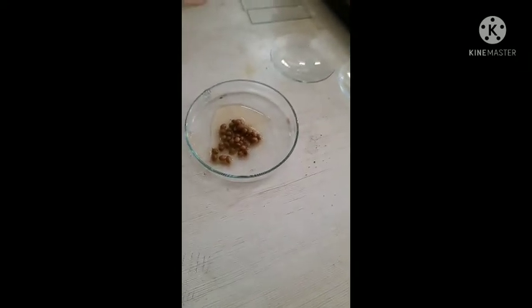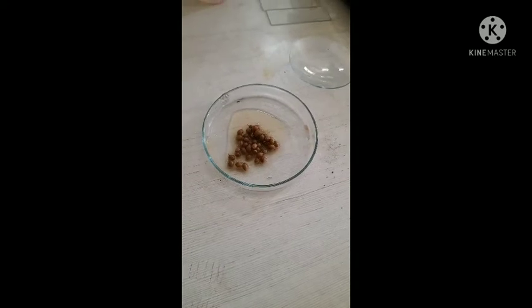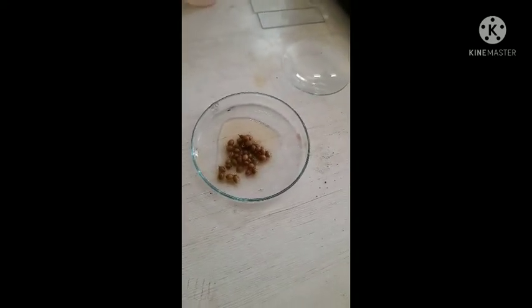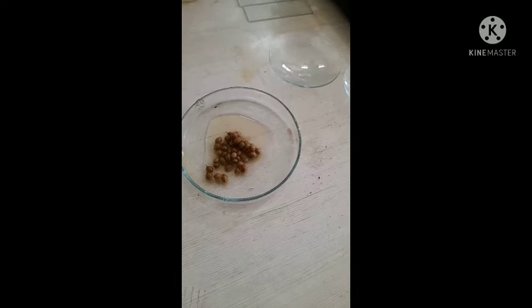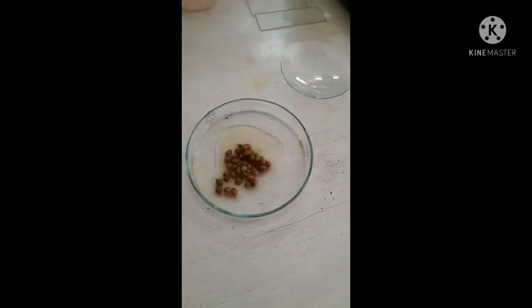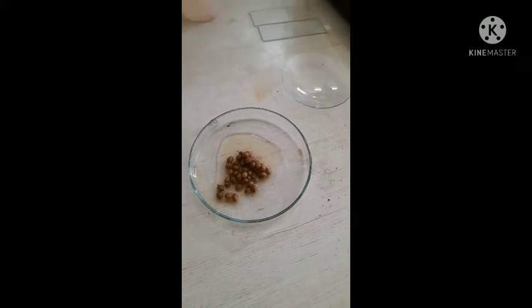First, we take the Coriander in a Petri dish which is previously boiled and cooled for 10 to 20 minutes. After 10 to 20 minutes, it gets soft. When it becomes soft, it is easy to take a thin transparent section of Coriander Fruit. It is a very tough fruit — that is why it requires soaking or boiling in water for 20 minutes.